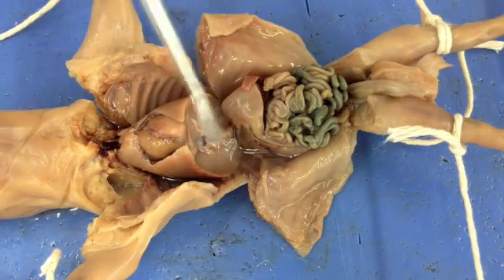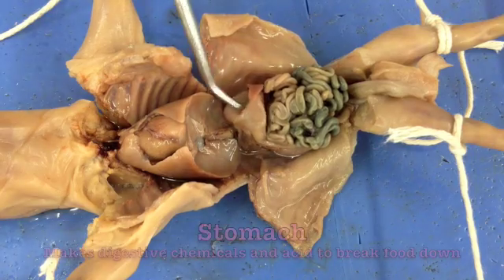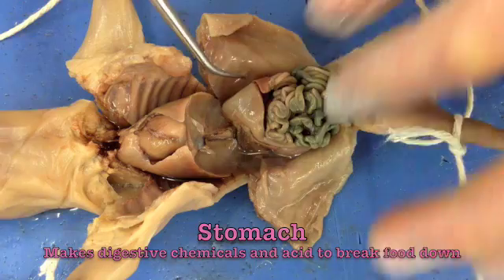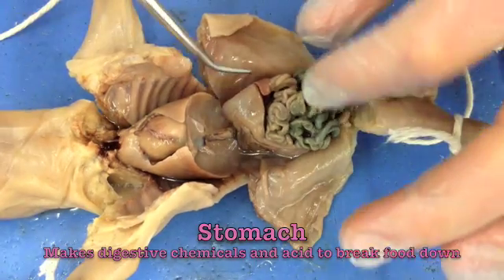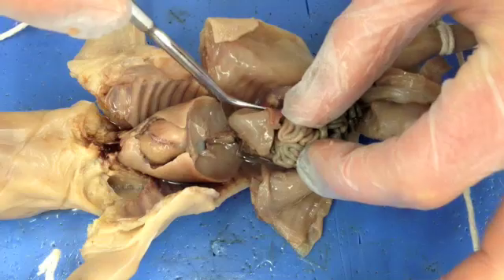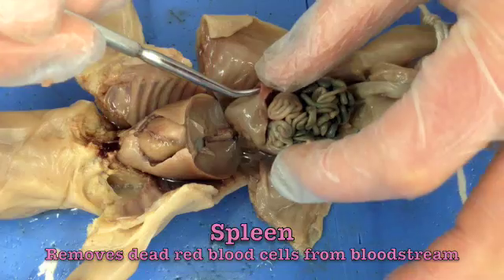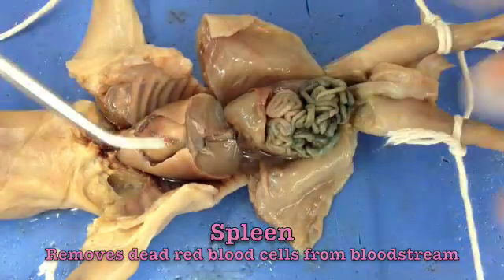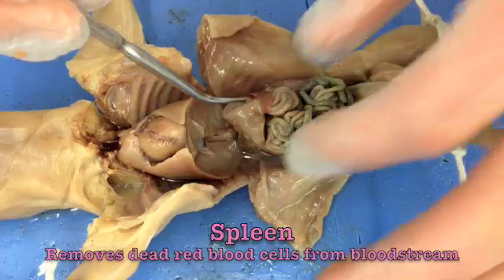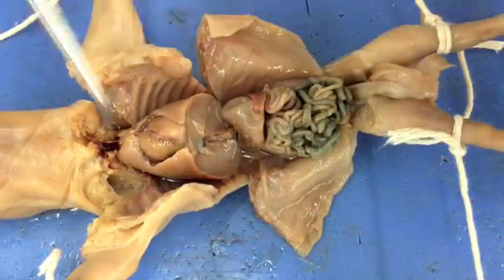As the liver is pulled away, underneath it lies this white sac, which is called the stomach. To the side of the stomach is a red organ referred to as your spleen. The purpose of the spleen is to remove dead or damaged red blood cells and remove them from your circulatory system.